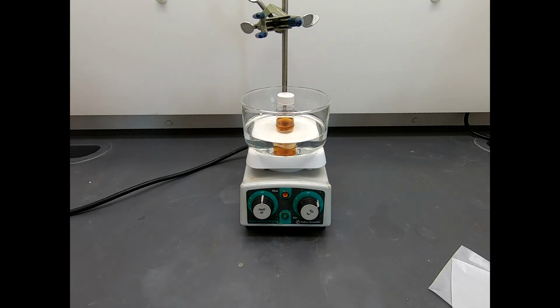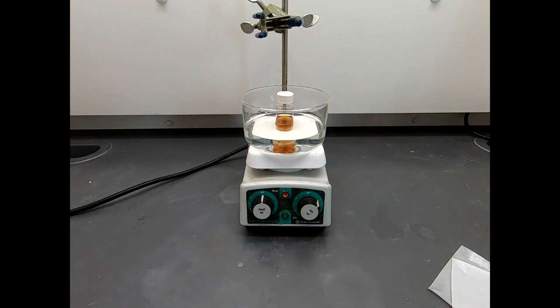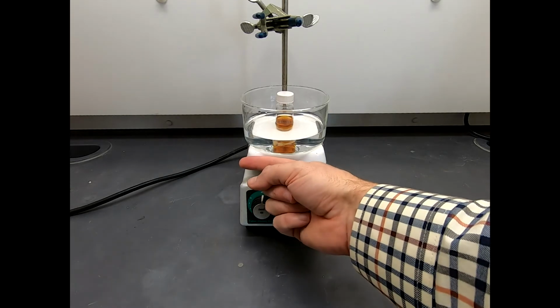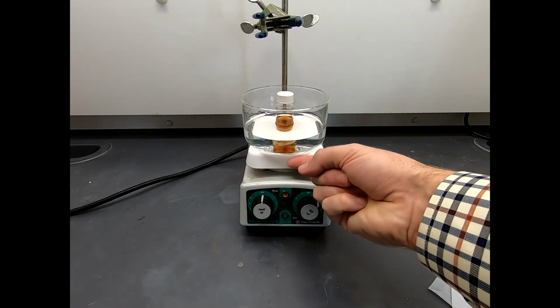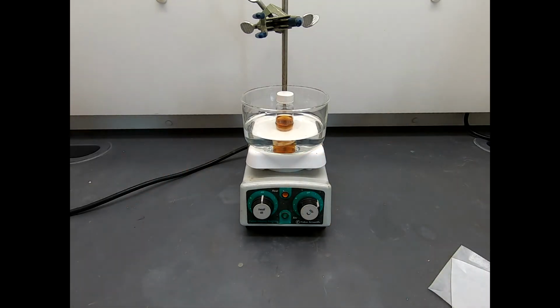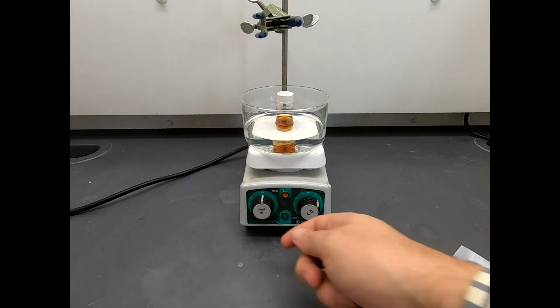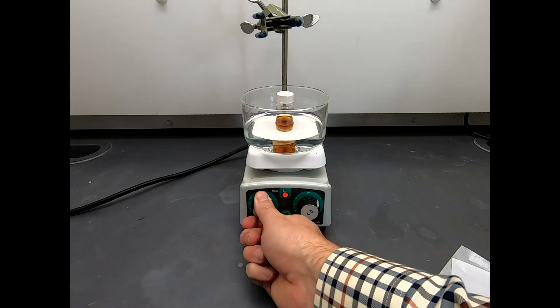Now, I'm going to turn on the heat. Be careful with hot plates. If you notice, my bath is actually bigger than my hot plate surface. So if you turn up the hot plate too much, you basically have really intense heating over the ceramic top of the hot plate and no heating at all on this front edge and the side edges of the bath. And that high thermal gradient can cause glassware to crack. Even though it may be Pyrex or heat-resistant glassware, you don't want to push your glassware too much because it'll make a mess and you've got to reset up the reaction, and plus the glassware costs a little bit. So I'm just going to turn this on to 1.